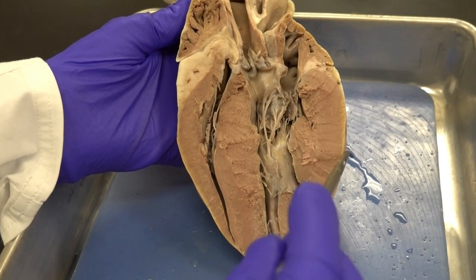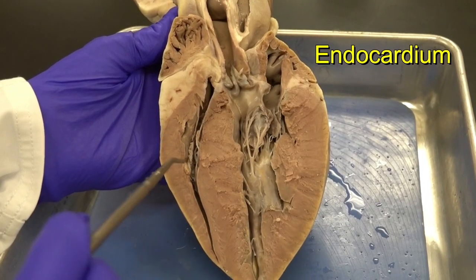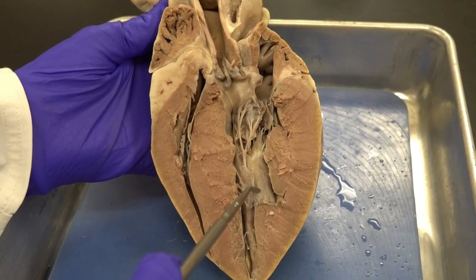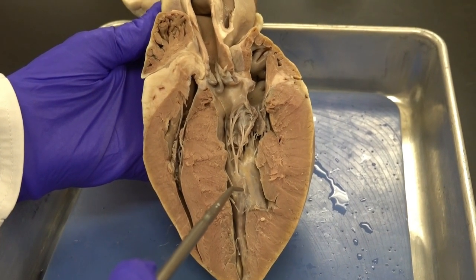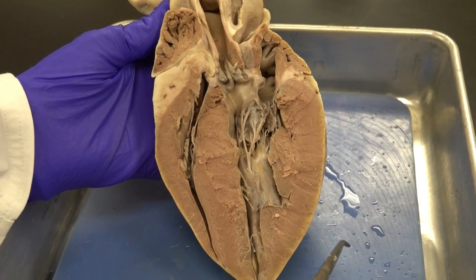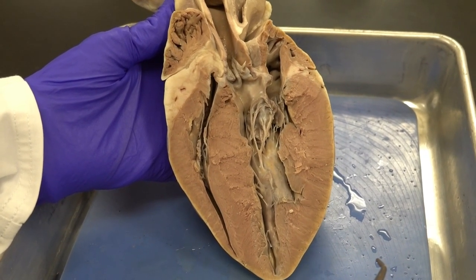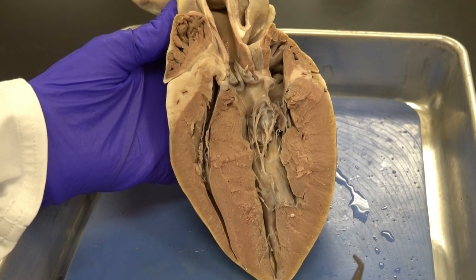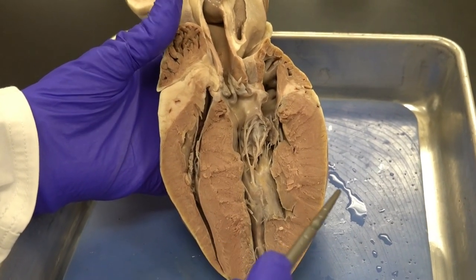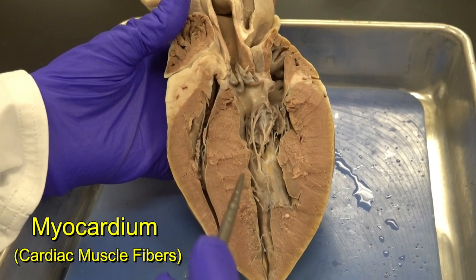In the wall of the heart we identify three layers. The outer layer is the epicardium, which includes the visceral serous membrane. The inner layer is the endocardium — a very smooth layer whose main function is to reduce friction between blood and the heart wall. Excess friction can initiate a coagulation process: platelets become damaged, their contents are released, and an unwanted blood clot can form. Between the endocardium and epicardium is the myocardium — cardiac muscle — which makes up most of the heart wall.